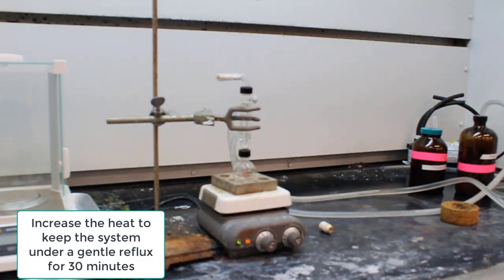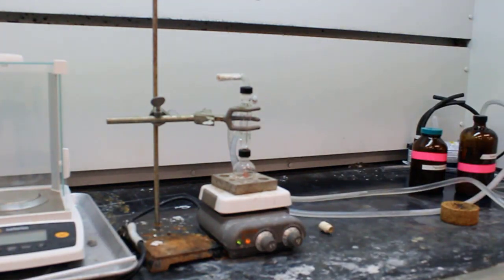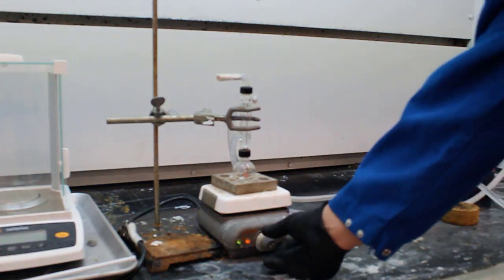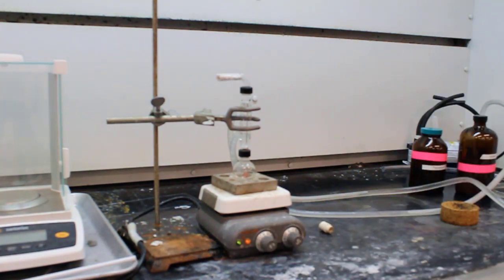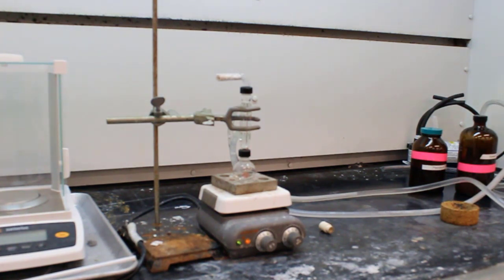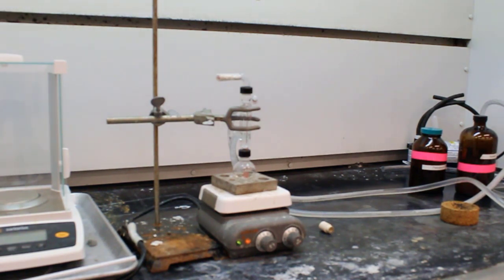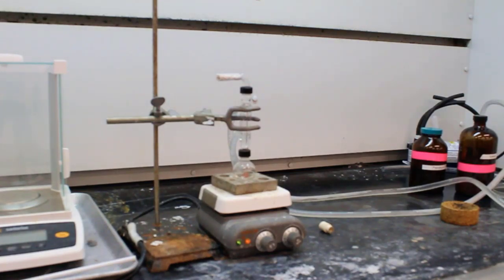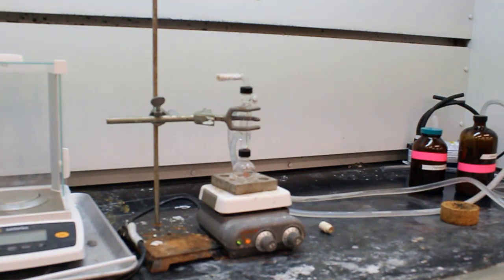Now we are increasing the heat so that we can get a gentle boil or a gentle reflux. For anyone who may not remember, in a reflux what we're doing is heating up your solution, which causes it to boil. Now, if we just heated something and allowed it to boil and the vapor went into the atmosphere, we could not collect that back, and we would see the volume level of our solution decrease until we were all out of solvent.